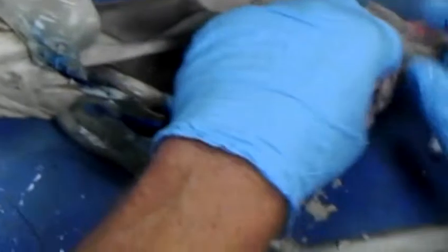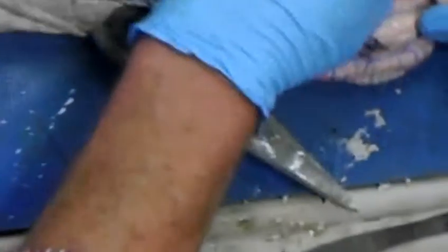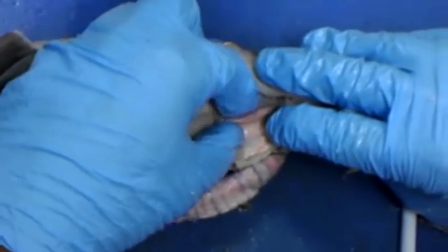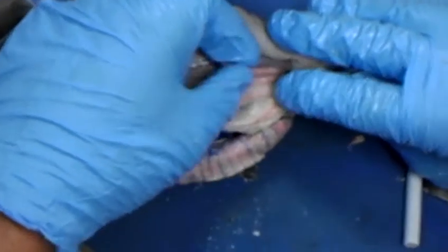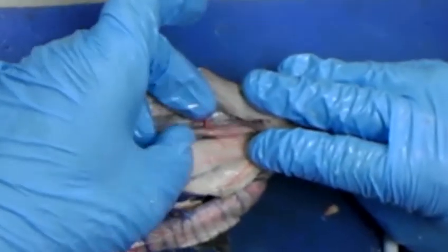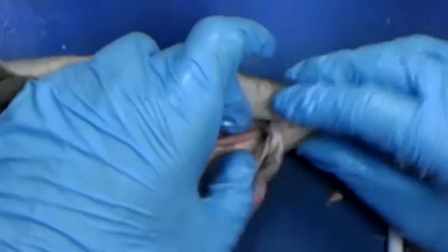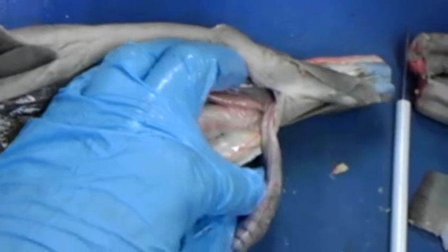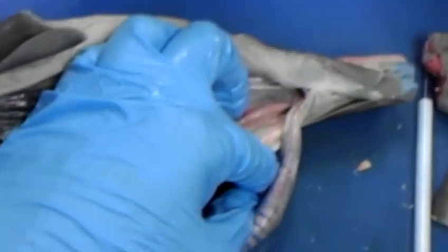Another structure that's unique to the sharks helps with osmoregulation. Everybody remember what osmoregulation is? Maintaining the right amount of salt and water. This is a rectal gland. This takes salt out of the bloodstream, see the blood coming to it, and then it drops into the rectum area. So it just helps get rid of some extra salt. Any questions?